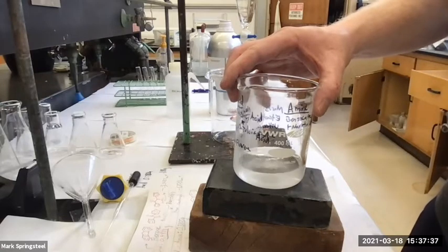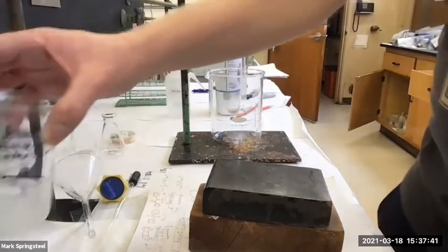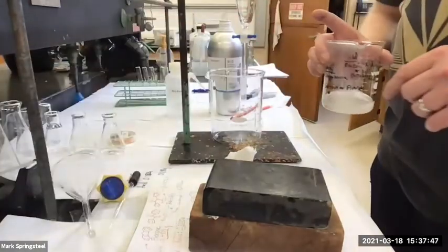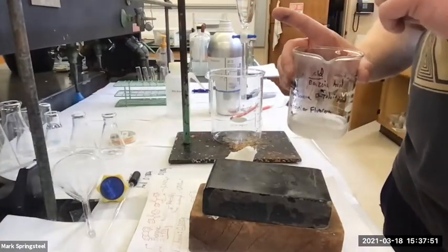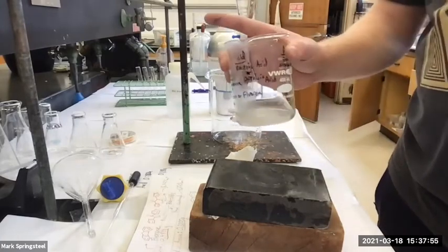So now, do you have to add a different solvent, or evaporate away the diethyl ether first, or just add more diethyl ether and let that sit? I'm gonna save that. If I need it, I can use it, so I'm actually just going to prepare a new sample. But I'll let this sit in case something goes wrong with the new sample. This can evaporate on its own, and I can still use it.